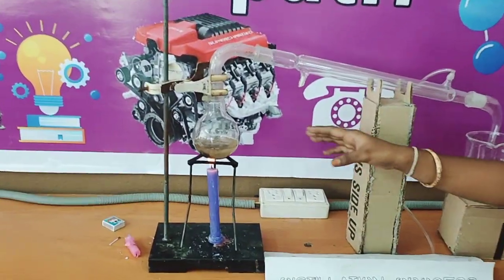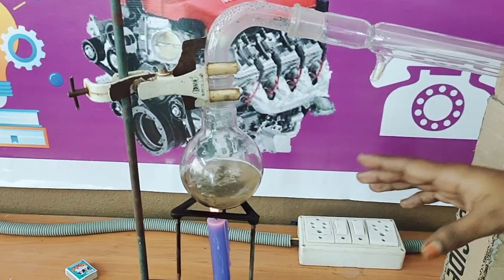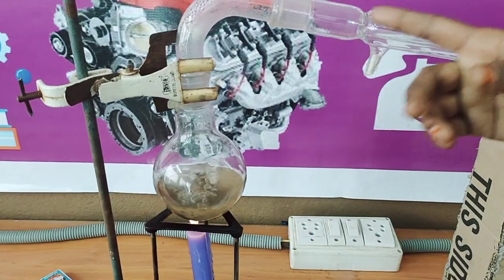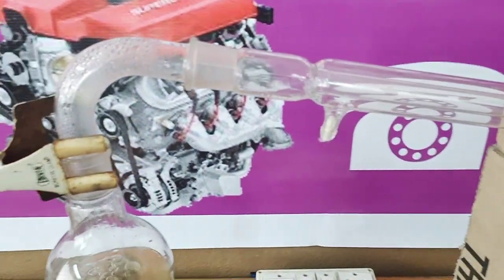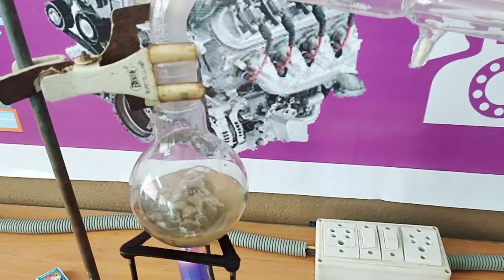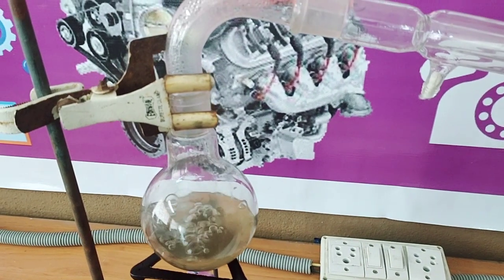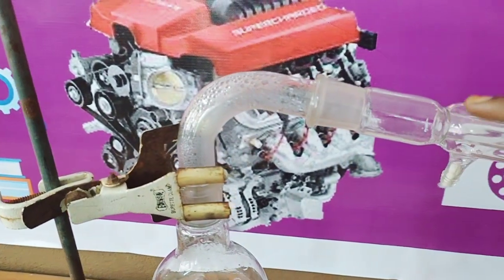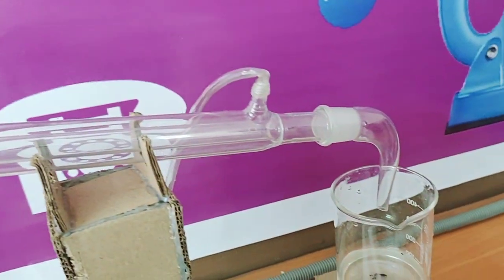We separated the alcohol and water in an RB flask. Take this solution in the RB flask and connect the condenser to it. Then heat the solution with a candle up to 80 degrees Celsius. You can see here the vapor gets converted into liquid and comes into the glass beaker drop by drop.